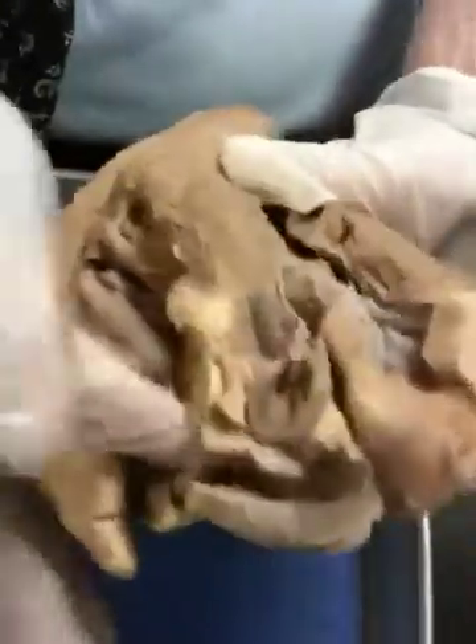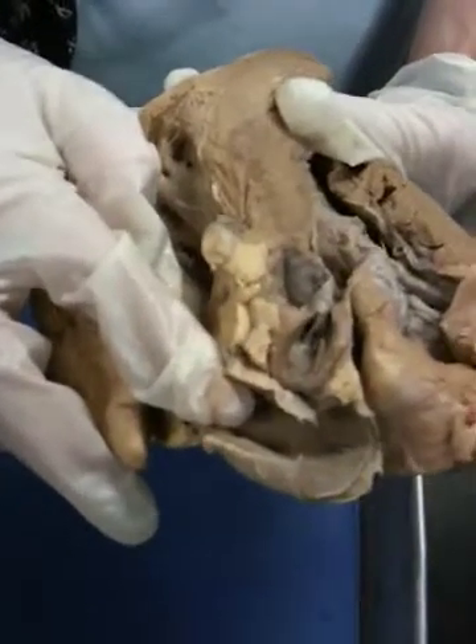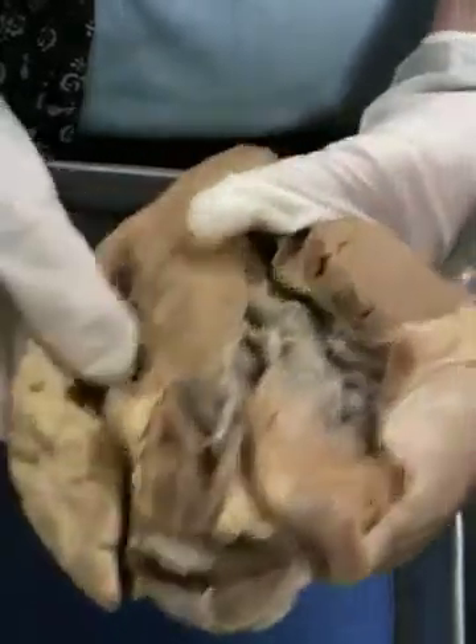Here's another pulmonary trunk and pulmonary valves. Even though they're not on every heart, we've seen two here. And I think that's all we really need to know.